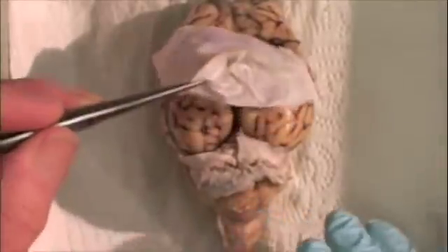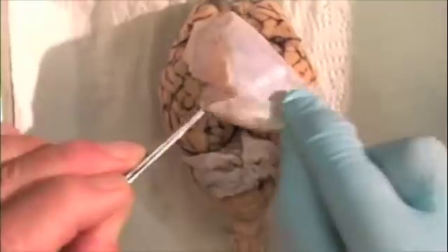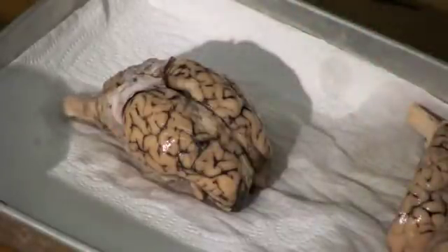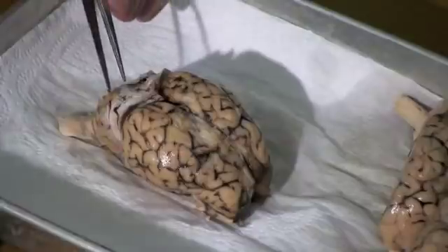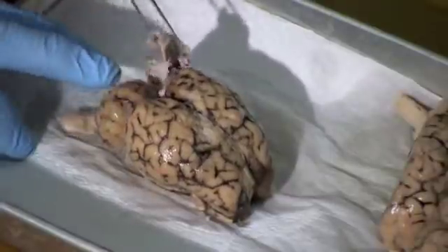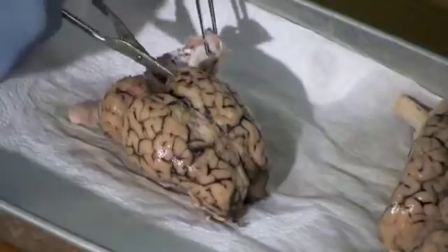Let's begin by removing the dura mater. Now in this sheep brain it's already been removed, so it's just sitting there on top of the brain. Notice it's very tough and durable. A partition of the dura extends between the cerebrum and the cerebellum — it's called the tentorium cerebelli, and this is particularly difficult to remove.